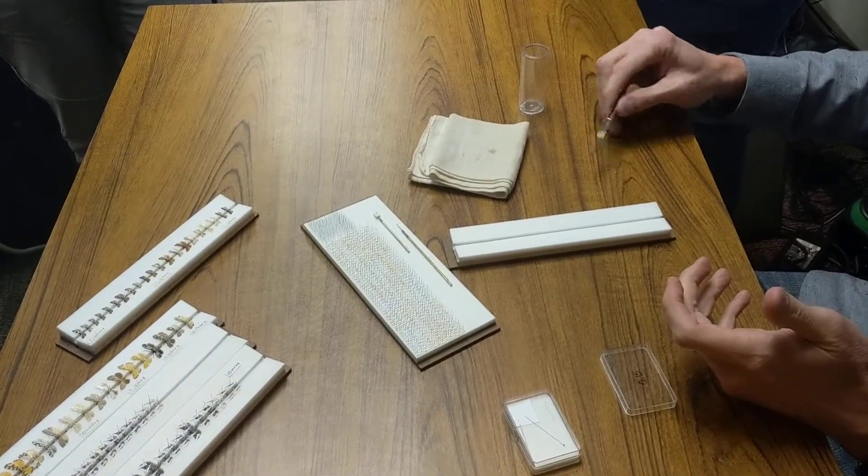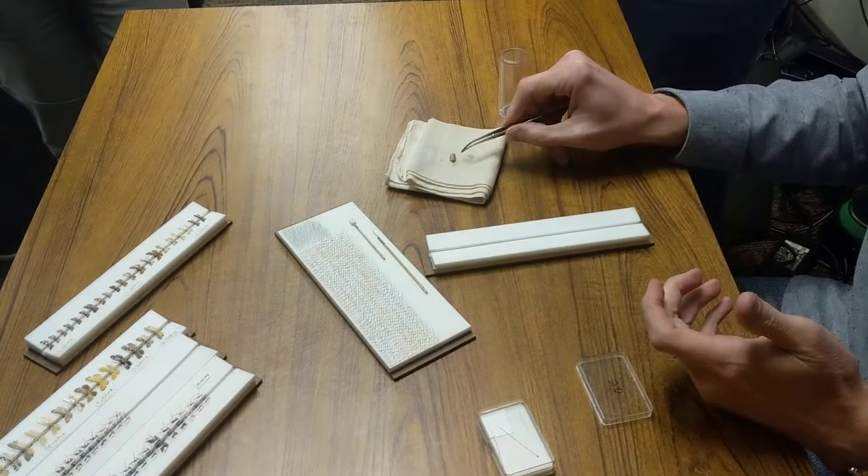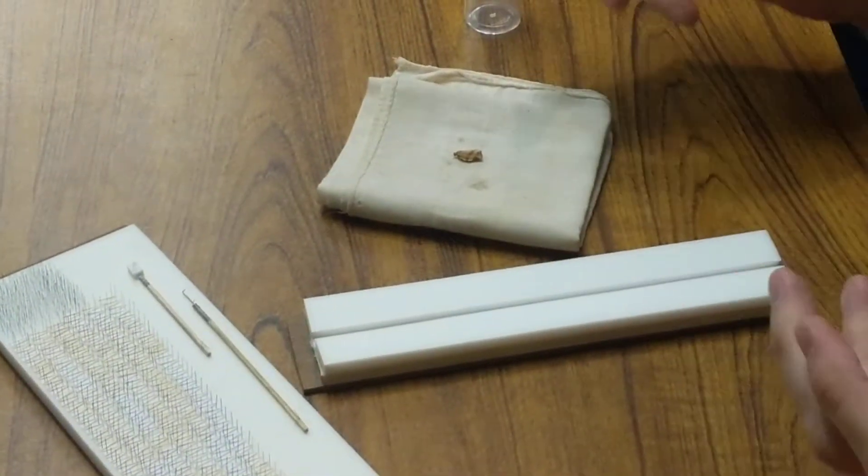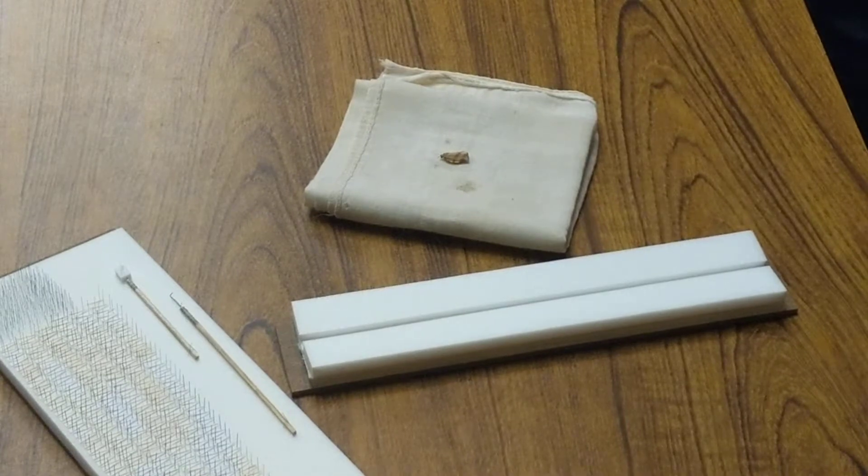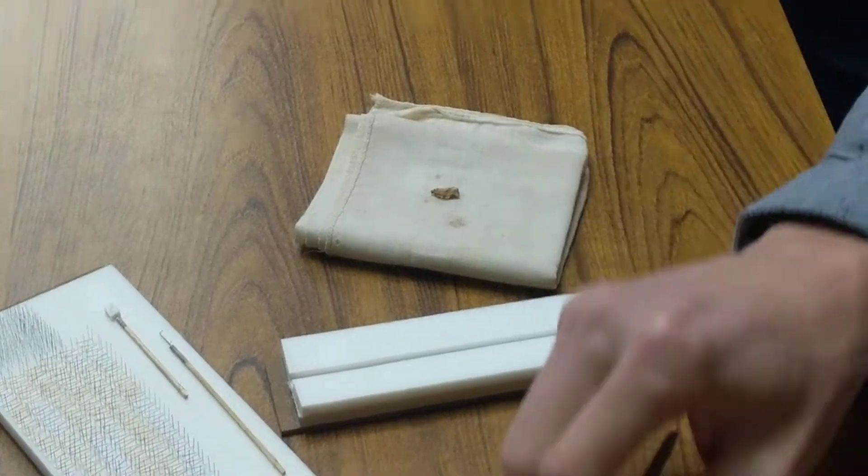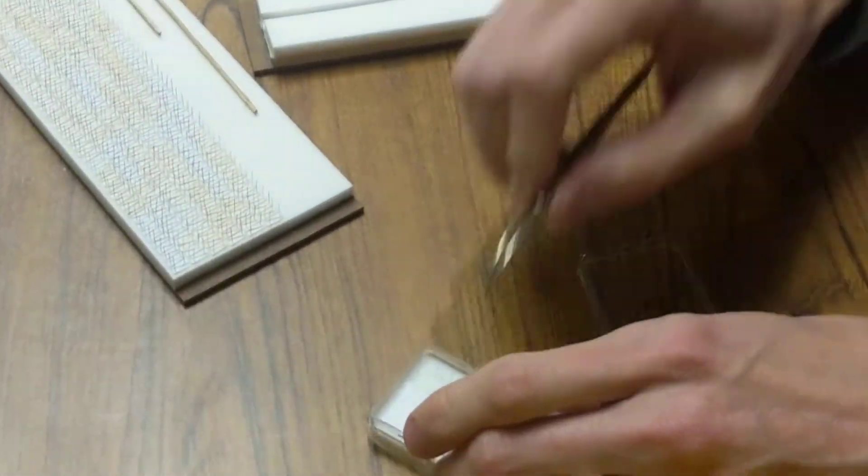So if you use a piece of cloth of some sort, I've had this for probably 20 years, it works pretty good. These are 0.15 minuten pins.